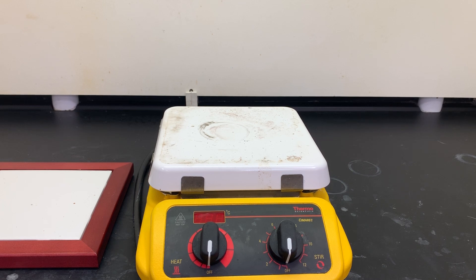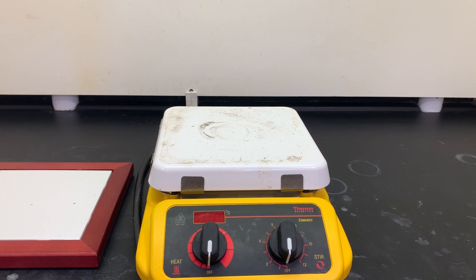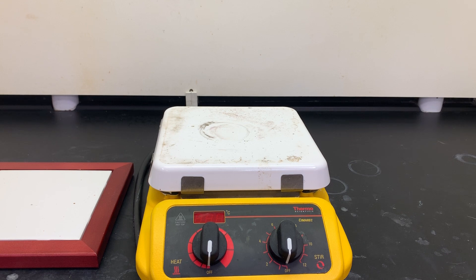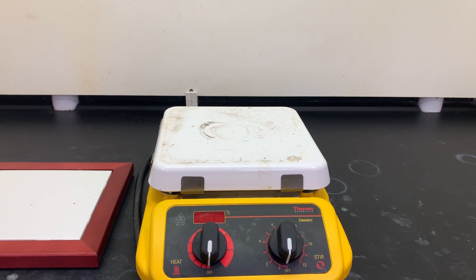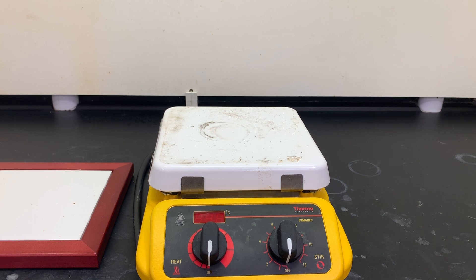In this lab we will be starting with copper and ending with copper. We will run it through a series of five different chemical reactions so we can demonstrate its properties and observe some of its compounds.